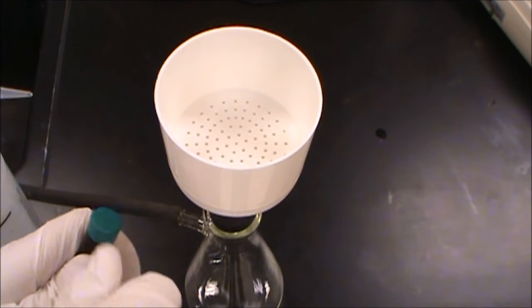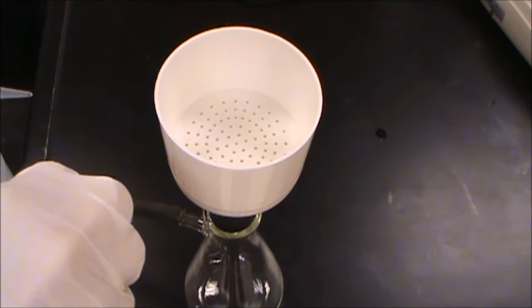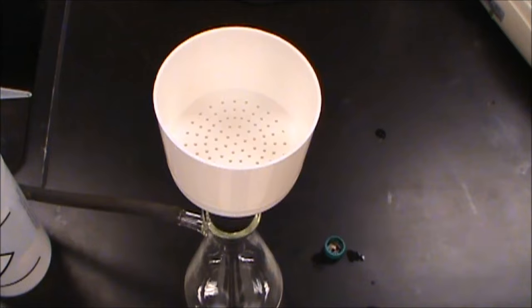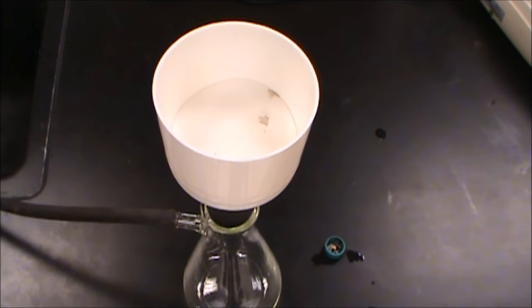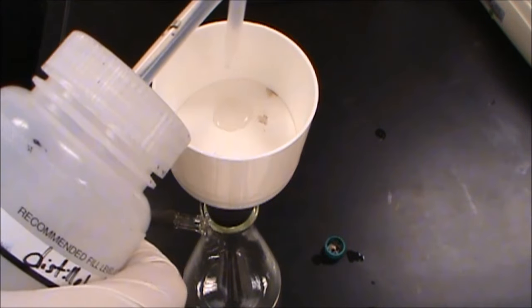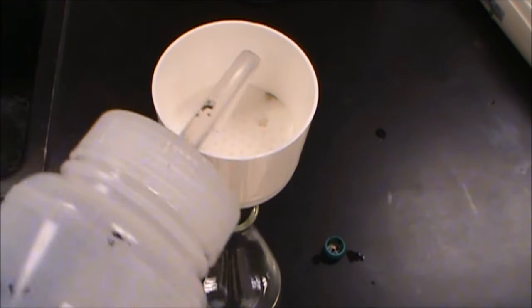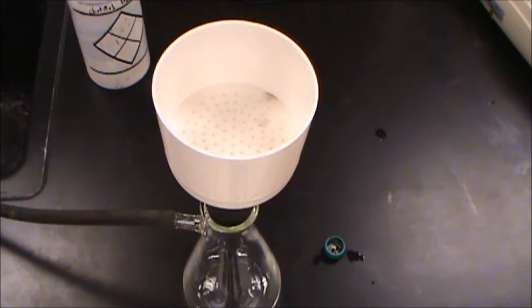So now we're ready to begin filtering. Again, even after this, you still want to be very cautious when you open the cap. You want to kind of cover it with your gloves so that anything that sprays out gets caught and not under your clothes or somewhere else. So we now have our indigo dye. It's mixed with a bunch of other things. So what we're going to need to do is we're going to need to set our filter paper in here. I got a little bit on my thumb there. We're going to turn on the water for the filtration system. And before we start, we want to get this sealed to the filter. So we're just going to add a little bit of water. That's going to start the process and hopefully seal down our edges. So we're creating a partial vacuum in here. That's going to help the water get pushed down in there. And when we pour indigo on there, that's going to help with that as well.